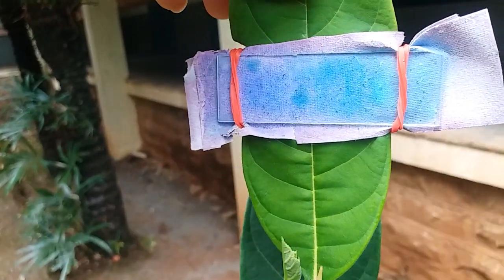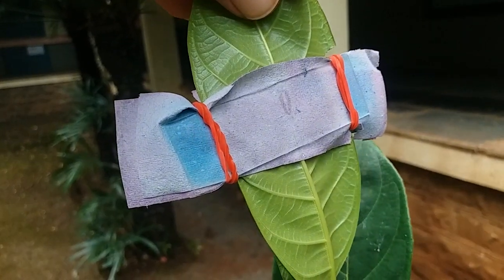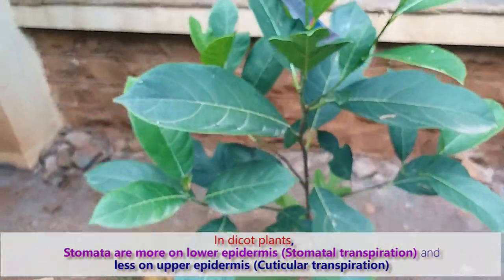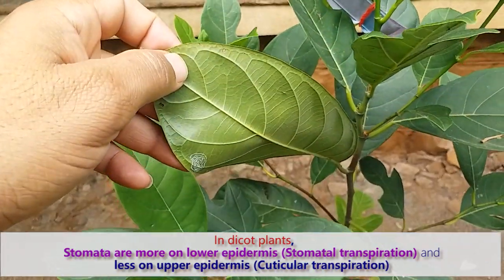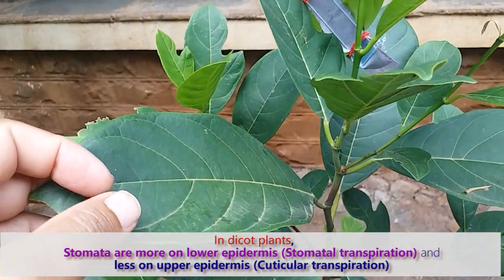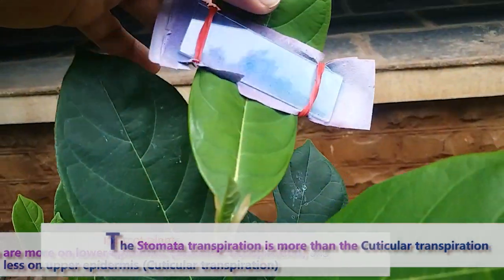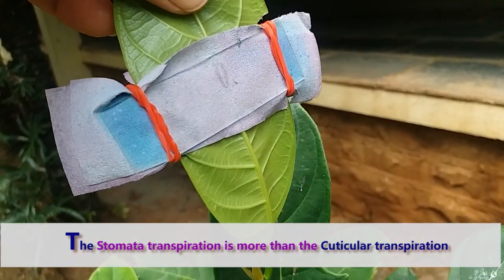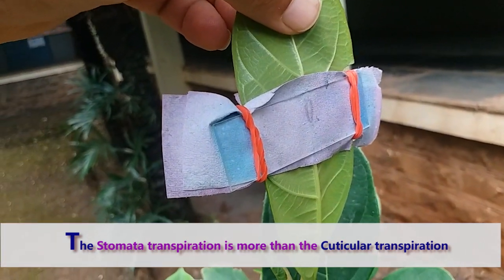This clearly indicates that the rate of transpiration on the upper epidermis is less compared to the lower epidermis. In dicot plants like this one, the number of stomata are more on the lower epidermis than on the upper epidermis. So transpiration occurring through the upper epidermis is considered cuticular transpiration, which is less. Since stomata are more on the lower epidermis, transpiration there is considered stomatal transpiration.